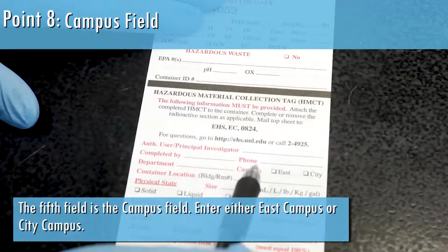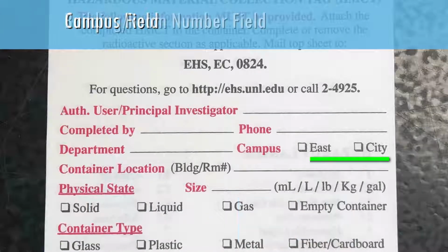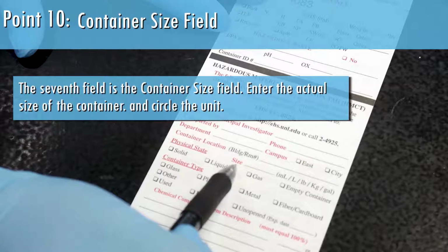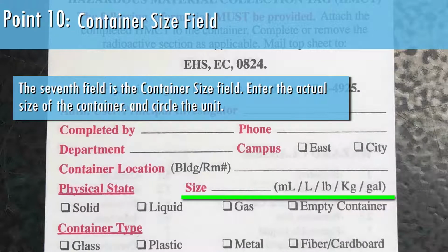The fifth field is the campus field. Enter either East Campus or City Campus. The sixth field is the building / room number field. Enter the actual location within the building where the material will be located for pickup. Do not use the office or mailing address. The seventh field is the container size field. Enter the actual size of the container and circle the unit.